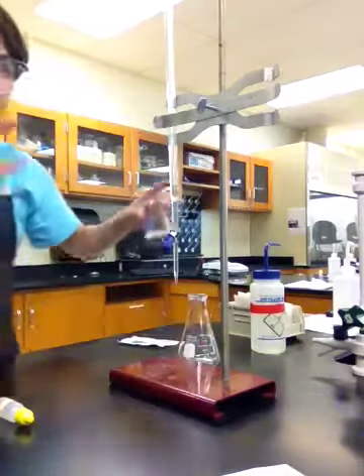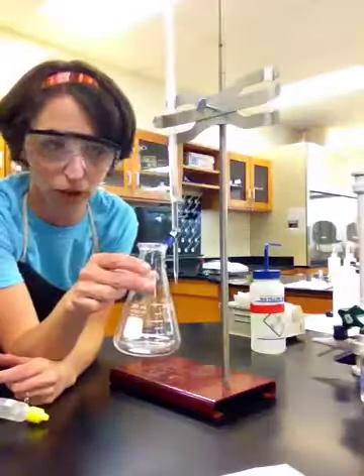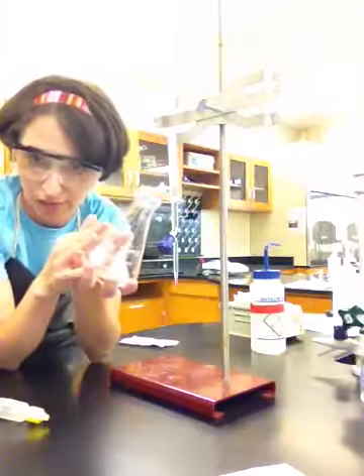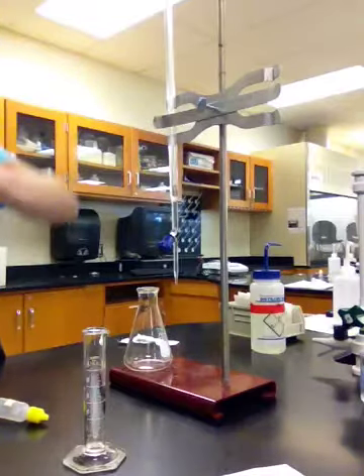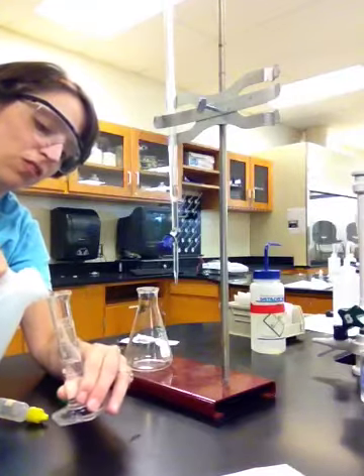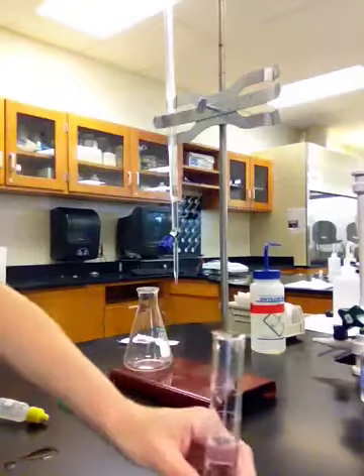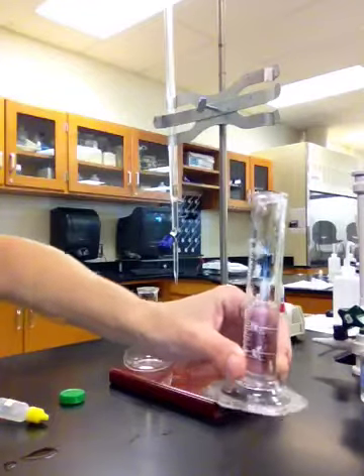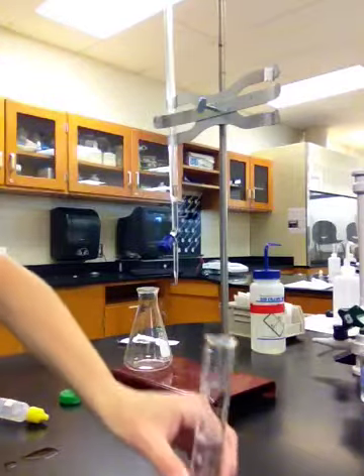Okay? All right, we are all set with the NaOH. Now, this is called the Erlenmeyer flask. Let me say that again, Erlenmeyer flask. Okay, and this is for what we're titrating. This is for our unknown. Okay, so I'm going to take some vinegar. Now the lab says use about 15 milliliters. It does not really matter how much you use. The more acid you use, the more base you're going to need to titrate it. What matters is that you do record that volume very accurately. So you guys can roughly see where the volume line is. So I'm going to say that looks like exactly, I guess, 14.50.